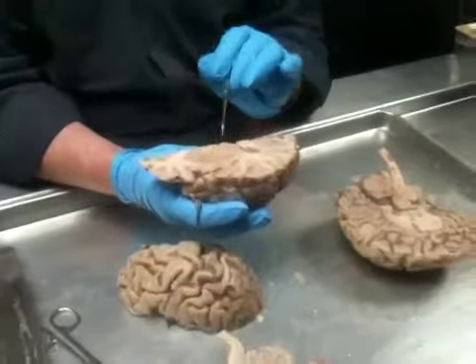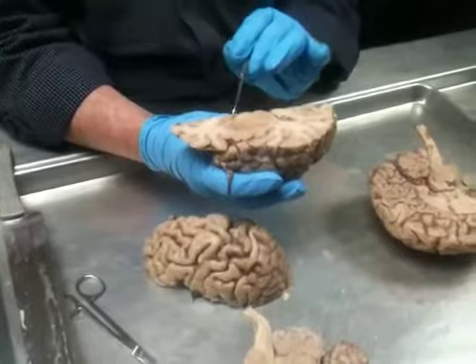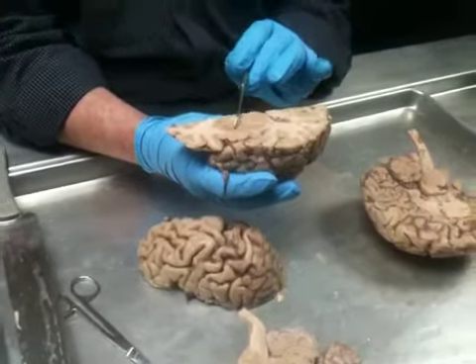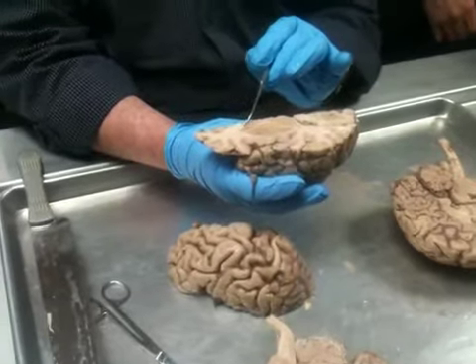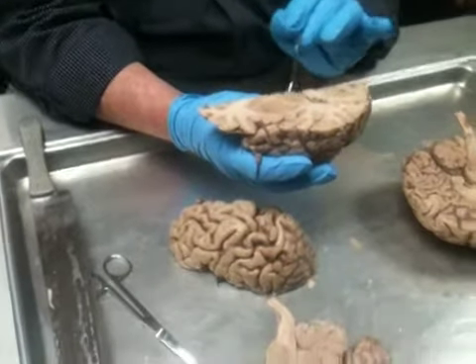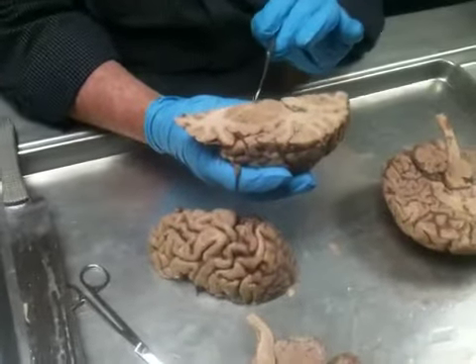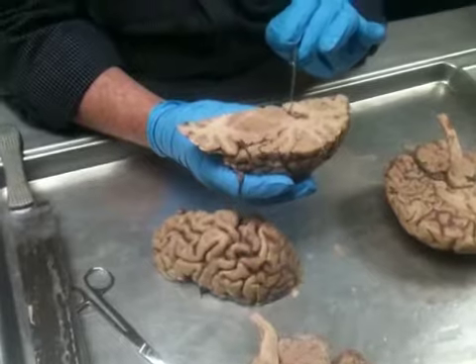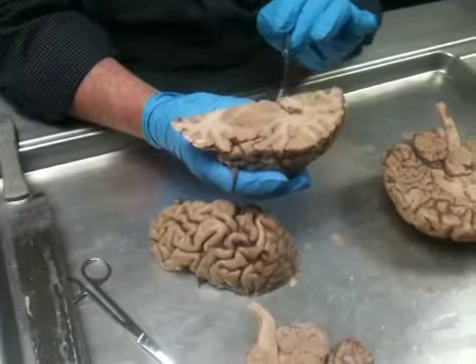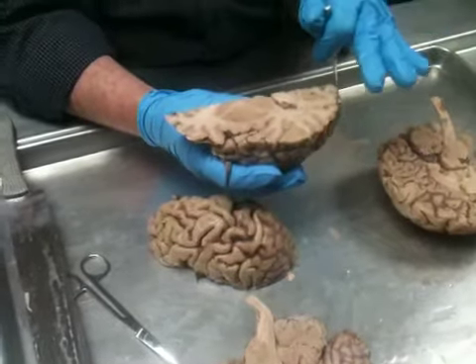Now, the other thing that you notice on this is that this internal capsule, this anterior limb, divides off the caudate nucleus, which is in the wall of the lateral ventricle. So here's the lateral ventricle. And the posterior limb divides the lentiform nucleus away from the thalamus. And remember, I told you, you're not going to be able to see specific nuclei in the thalamus. All you really see is this homogeneous gray area. Okay?